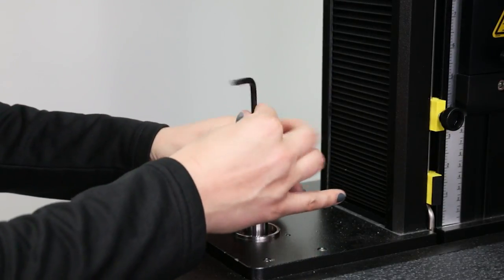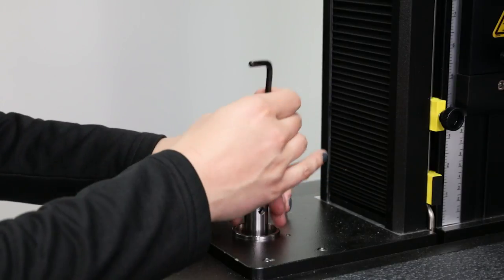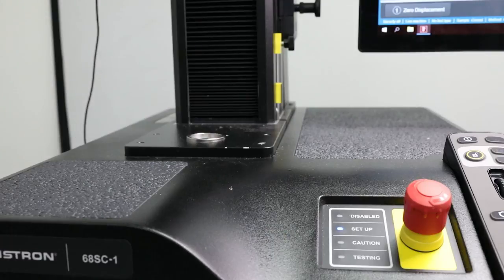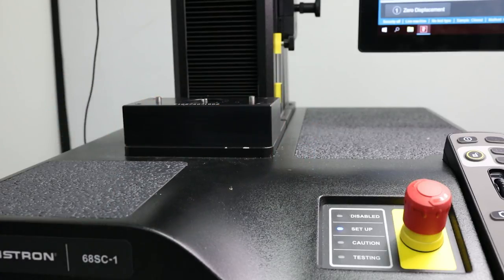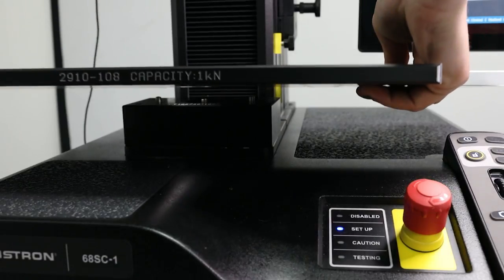To get started, we first need to remove the base adapter. Next, we take the included mounting block and place it onto the base of the system. This block is important since it provides the necessary clearance so that we are not interfering with our e-stop.